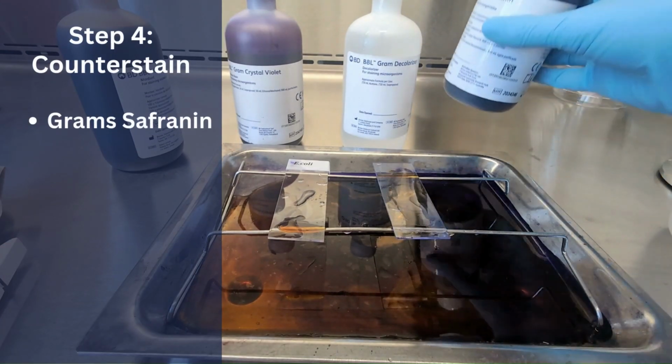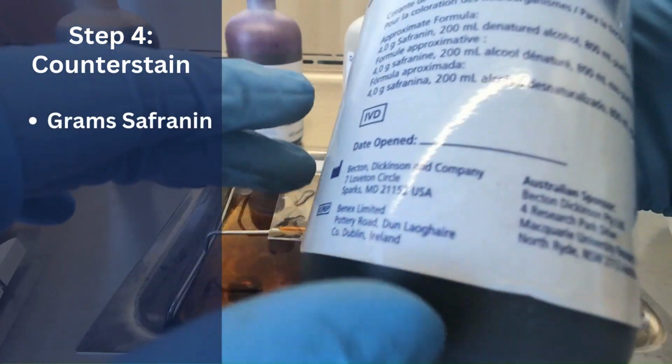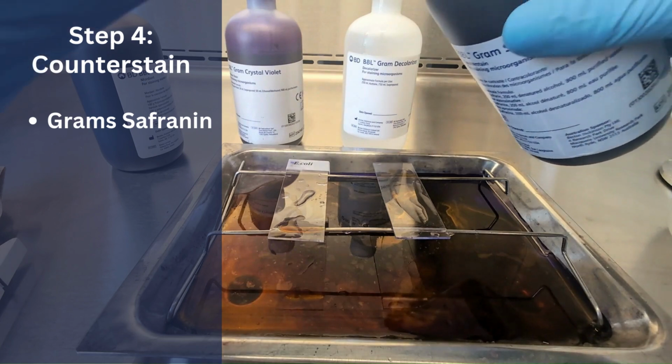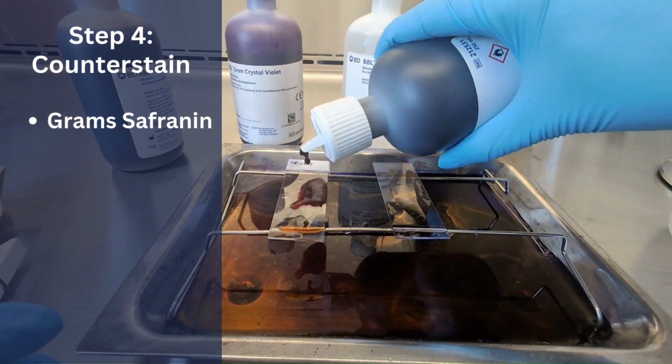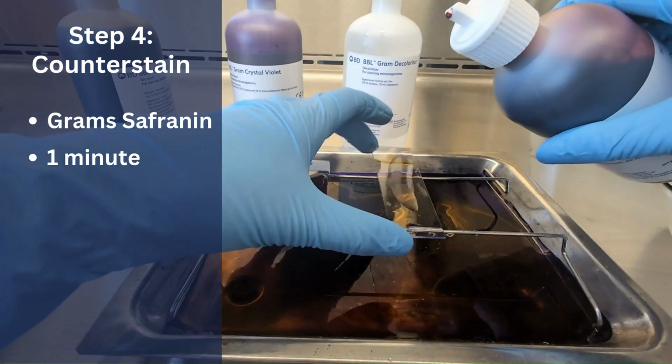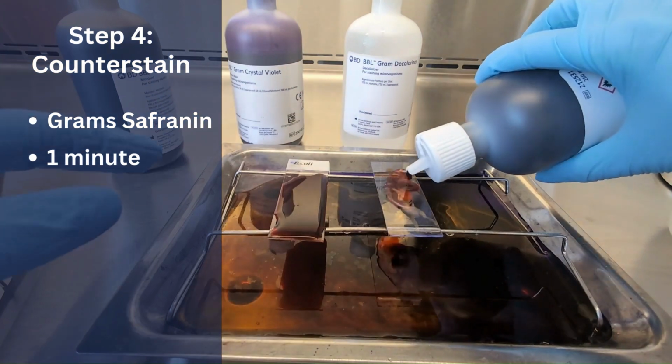The final step is application of the counterstain, gram's safranin. This is the final reagent and is used to stain the decolorized cells pink. The gram's safranin is then applied to the slide and left to sit for about 1 minute.